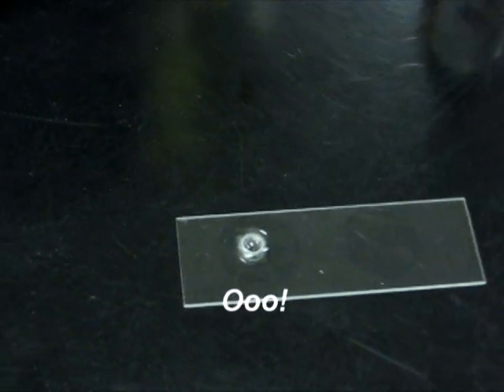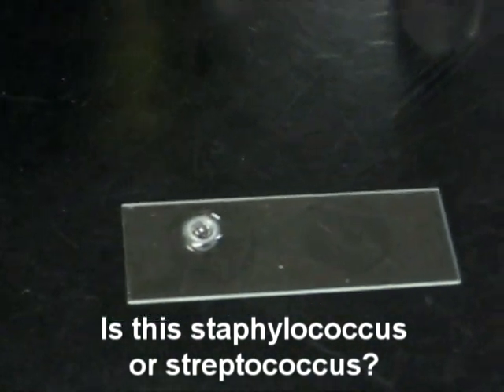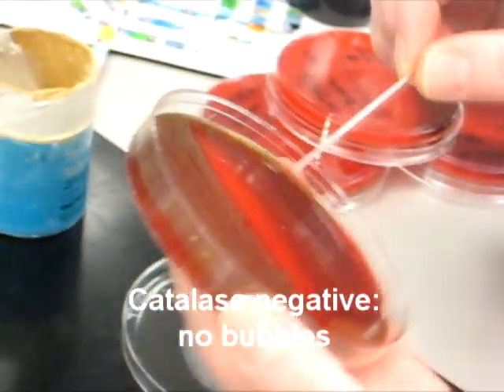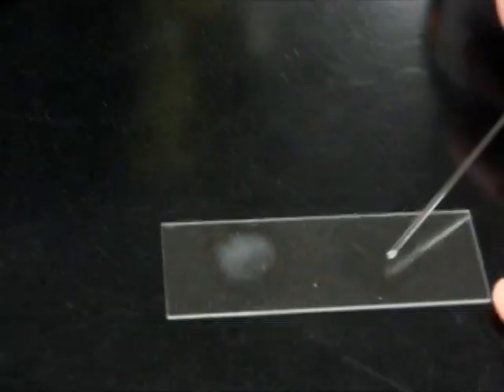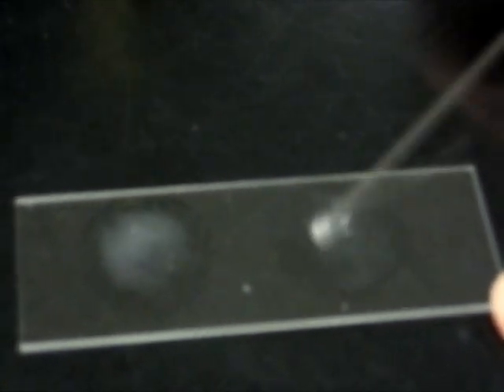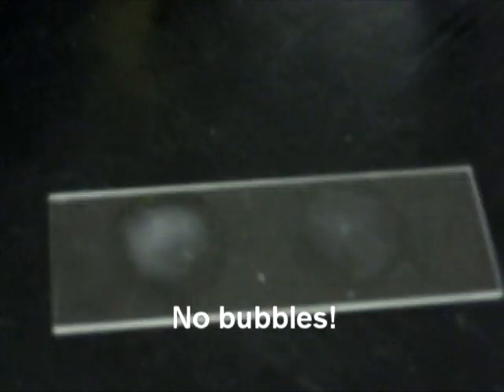Ooh, I see bubbles. If the organism is catalase negative, there will be no bubbling when the colony is added to the reagent. You can just see the organism floating in the wet mixture. No bubbles.